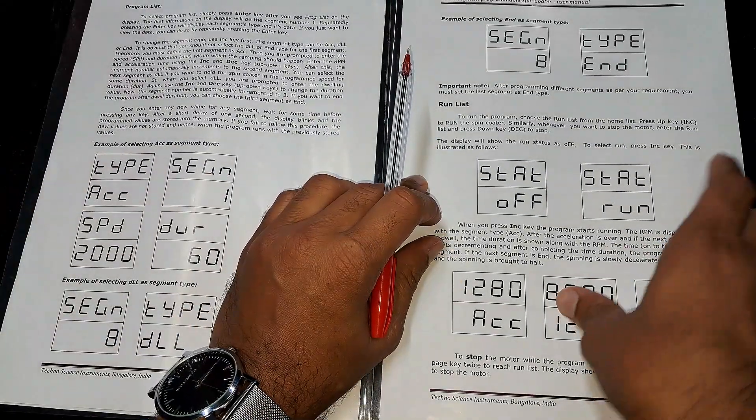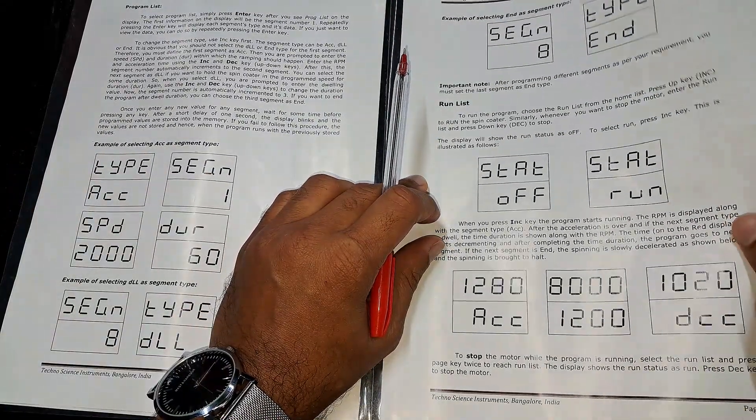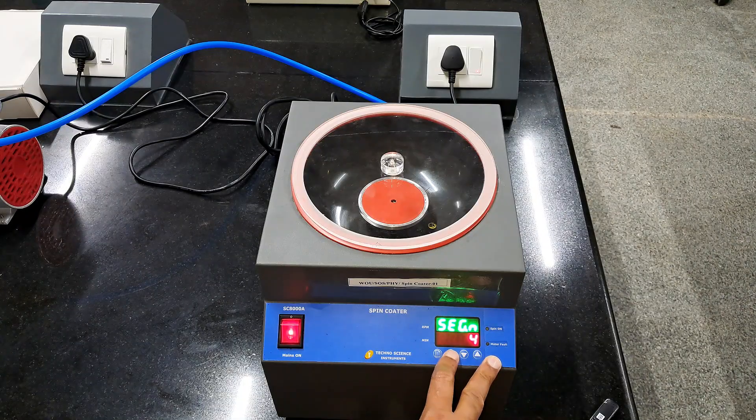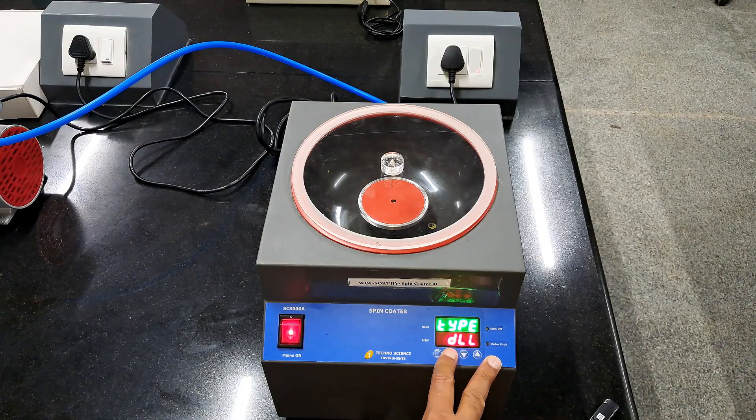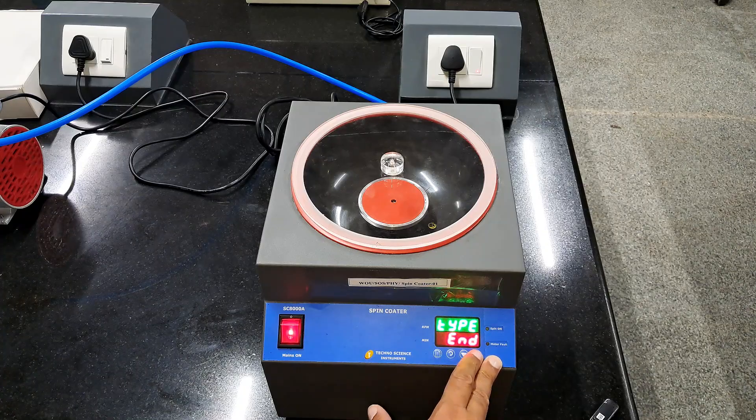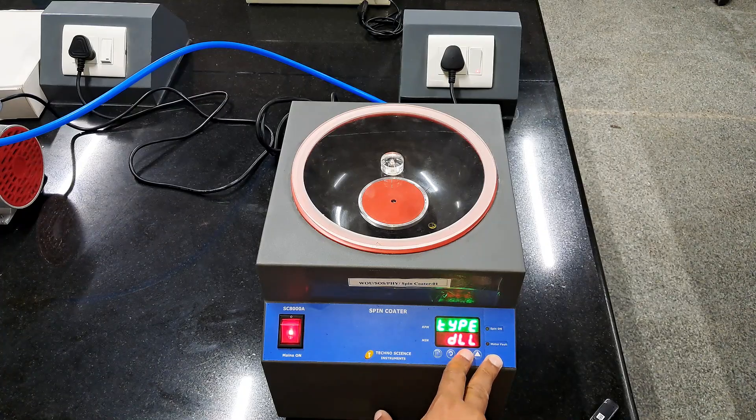You can run it with either one, two, or up to seven segments. It's up to us as per needed. But don't forget to keep the last segment as the end, or else it will keep running in the loop.